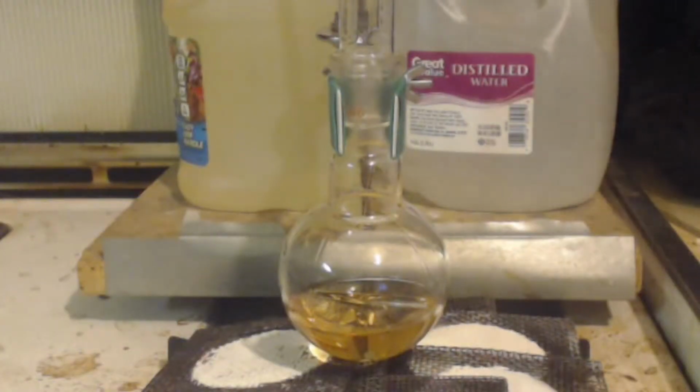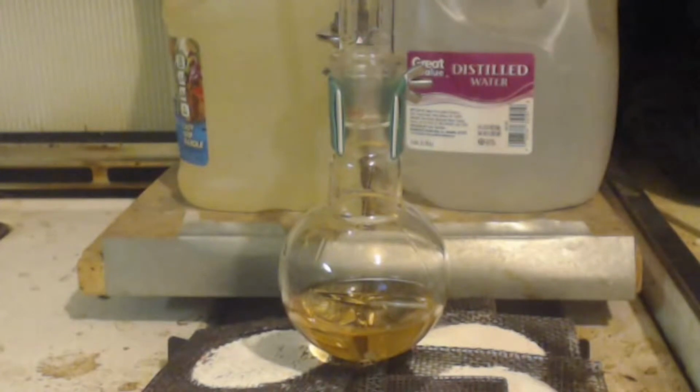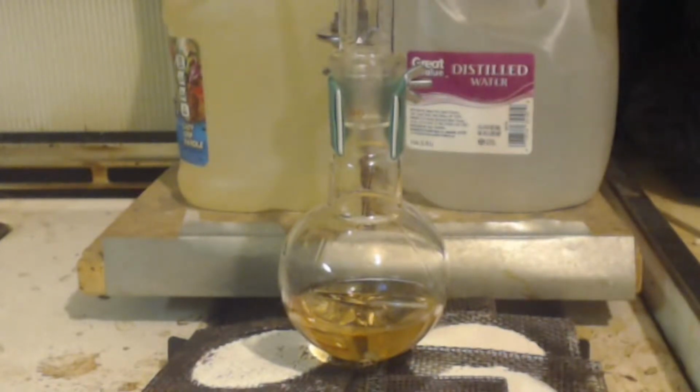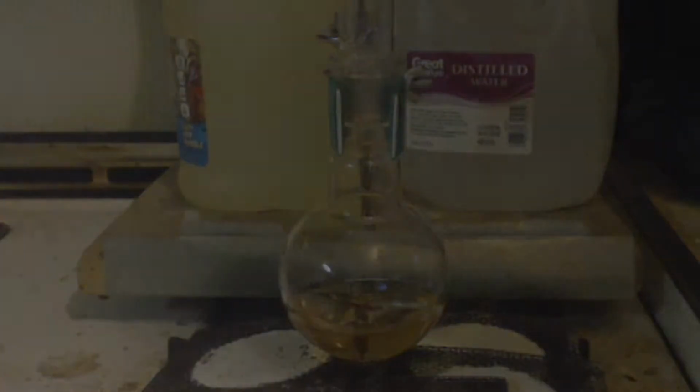Keep in mind, this is not an instructional video. This is a blog or vlog or whatever you call it of me learning this reaction. This is only the second time I've done this reaction. Keep in mind, ether is flammable, very flammable, and I'm sure that the tert-butyl and all these chemicals are all bad for your health. So if you repeat anything in the video, do it at your own risk.